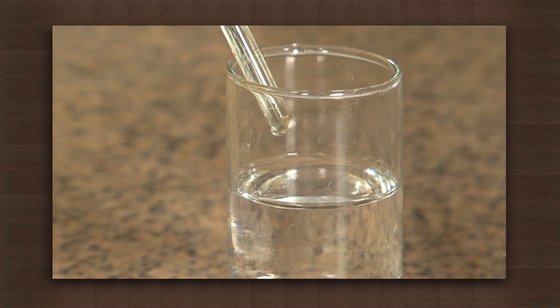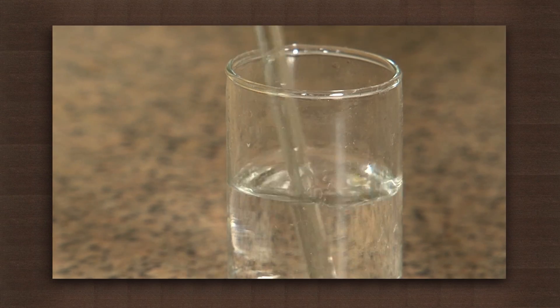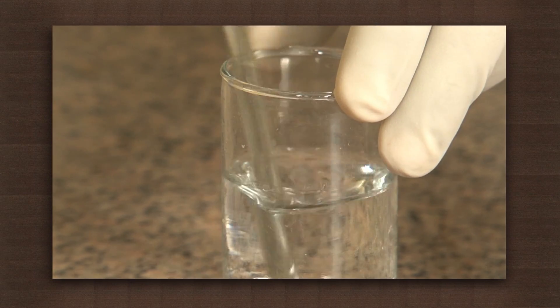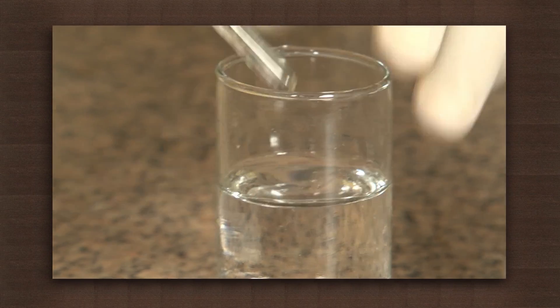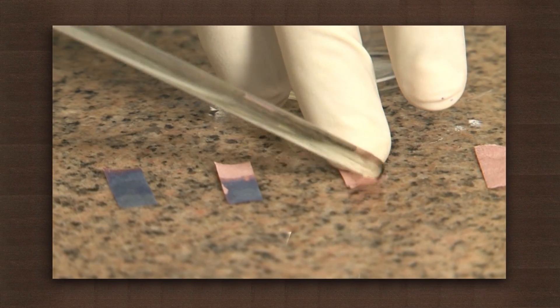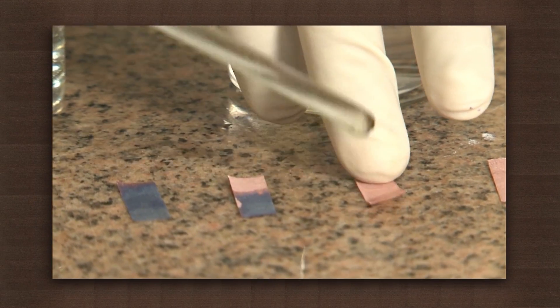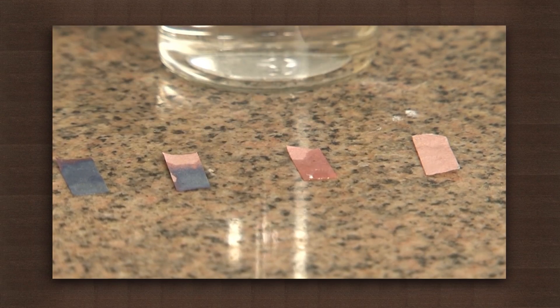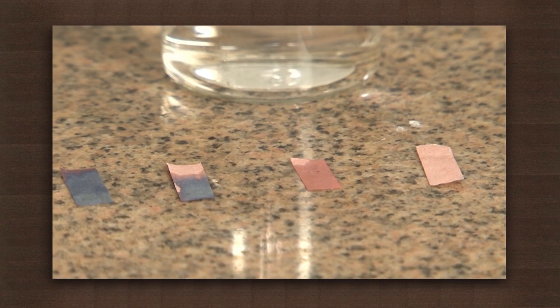After a few drops you will see that the solution no longer changes the color of red litmus paper. Now what we have is a neutral solution which is neither acidic nor basic. If you evaporate the water from this, you will find a residue — or if you let the solution settle, you will be able to see a residue at the bottom. This residue is a salt.